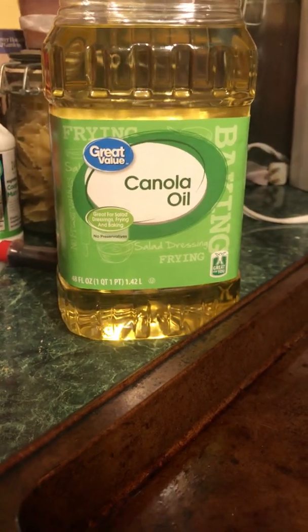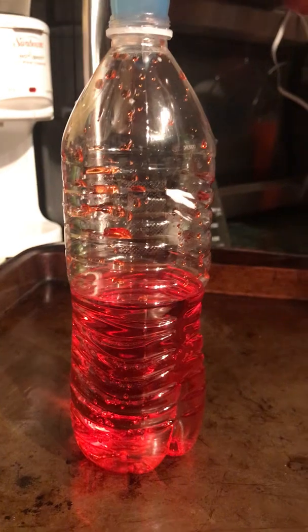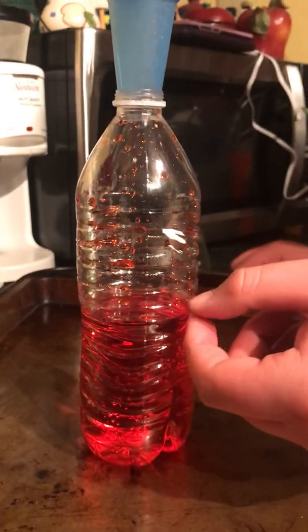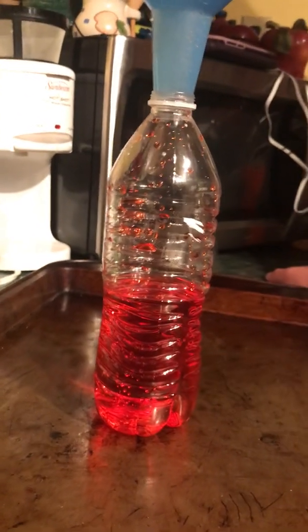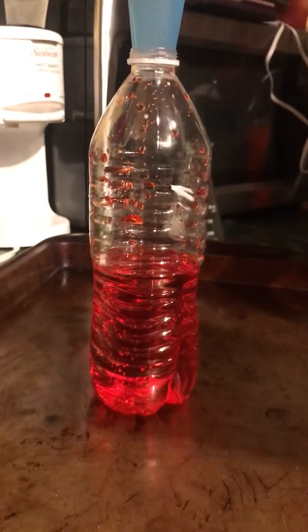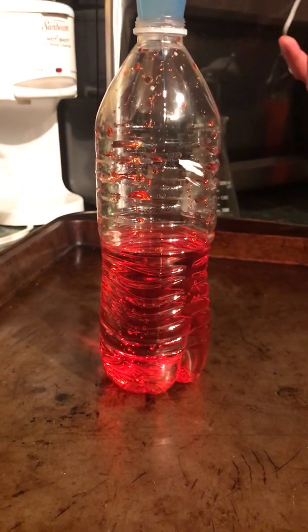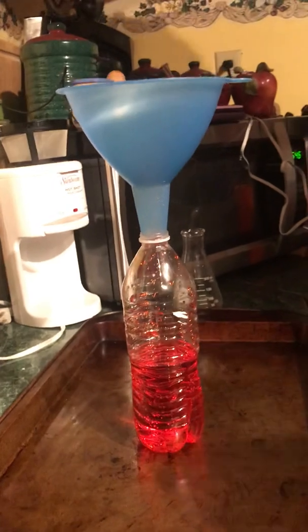And so what we're going to expect to happen is that the oil is going to sit on top of the water and it's not going to mix. Well, we're also going to notice when they meet, you're going to find some bits of water and oil stuck together. And that's where we're going to see the London dispersion forces, because the oil is going to temporarily form a weak positive and a weak negative end. And so that's going to attract the water. But that doesn't last very long, so it's usually really hard to see.